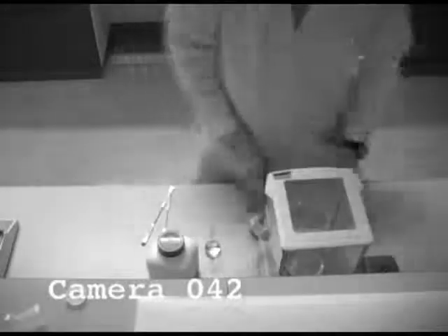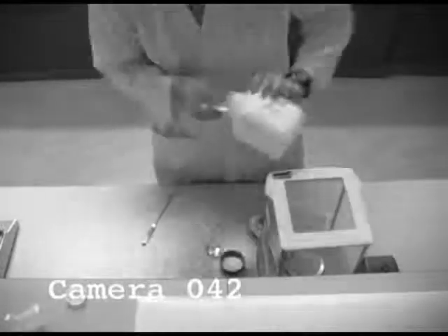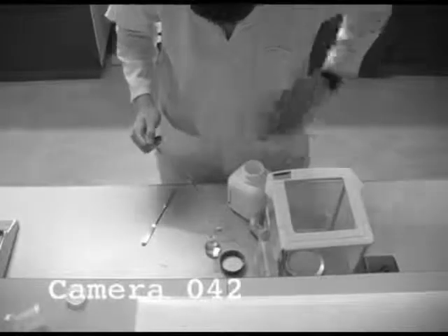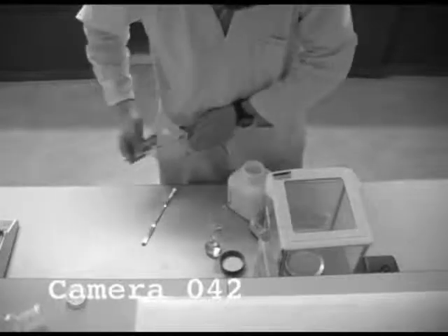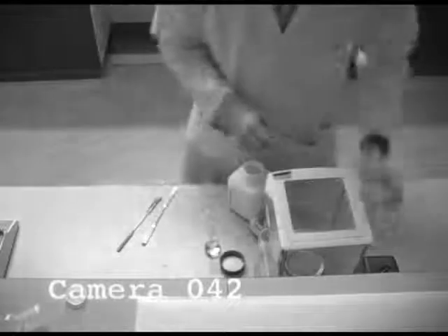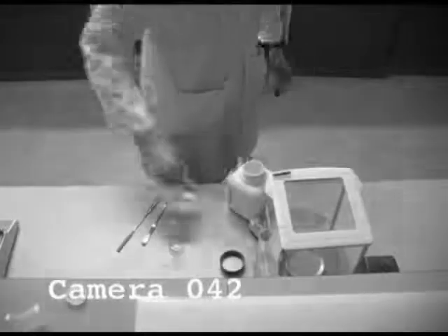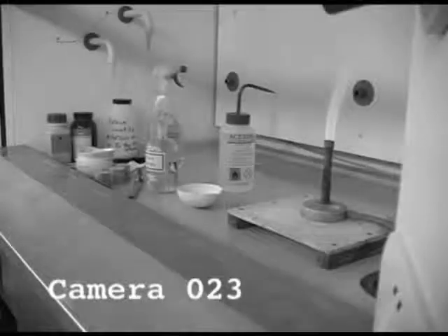Now, let's just fast forward this bit with you using a balance. Now, again, I notice no gloves and spillage. Did that go on your hand? And so you wipe your hand and your spatula on your lab coat. I didn't have any paper towel to hand, and I thought it'd be the safest thing to do. To wipe a chemical onto your lab coat?